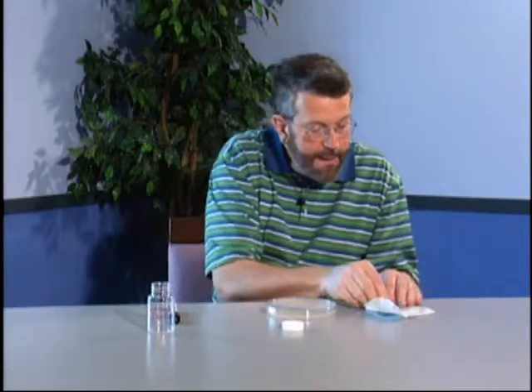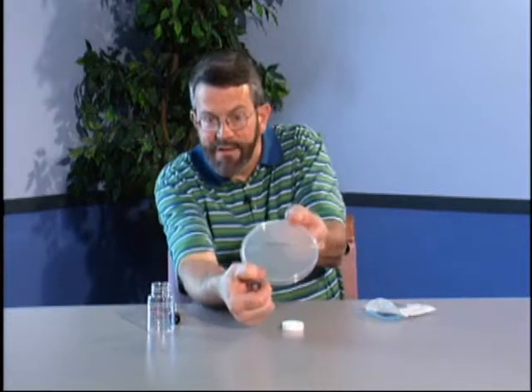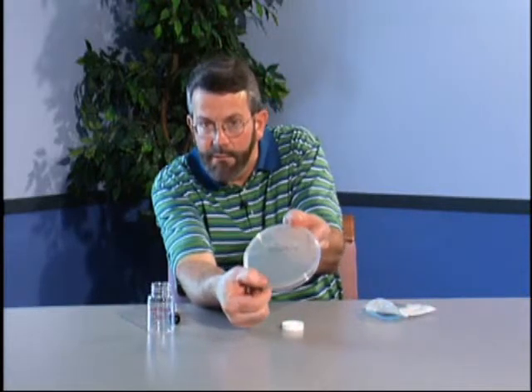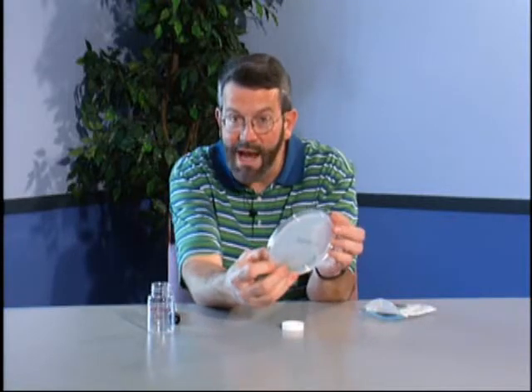Now, if you will note, there's nothing there. See, there's nothing there. I just made the smear. But you let me incubate this little puppy for 24 hours and see what happens.